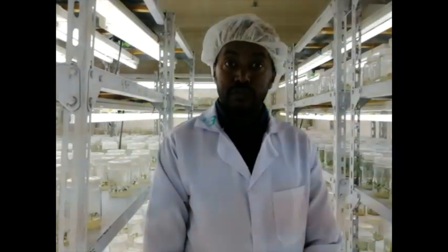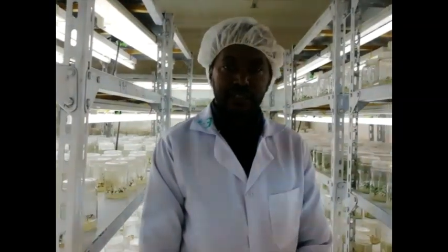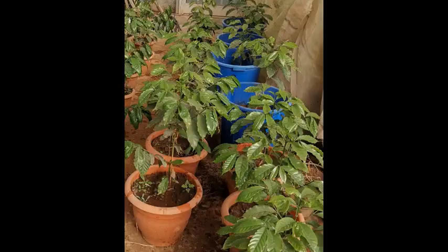Therefore, we have 2 major problems in this case. The first one is identification of embryogenic callus histologically. Morphologically we can identify it, but histologically we have technical problems. The second technical problem is that after obtaining embryogenic callus, establishing a suspension culture is our second major problem. Because of this, we transfer embryogenic callus directly to regeneration media, skipping the multiplication media. The next step is elaborated by my colleague. Thank you.